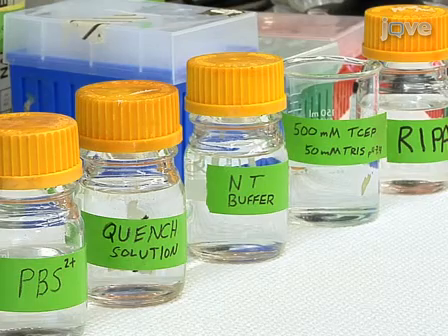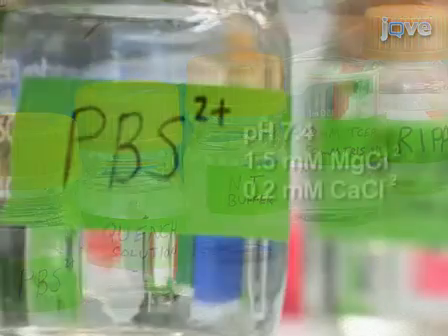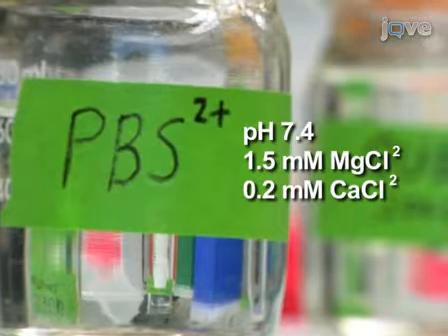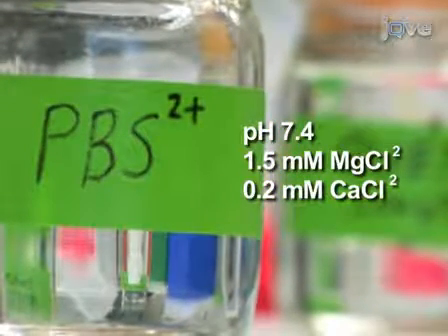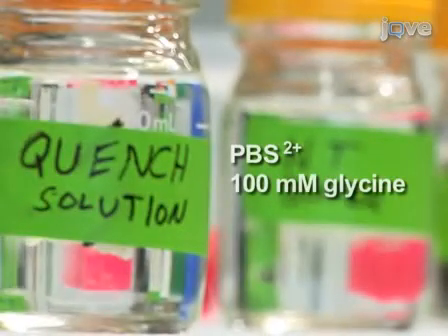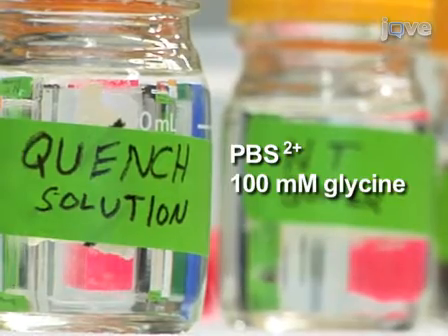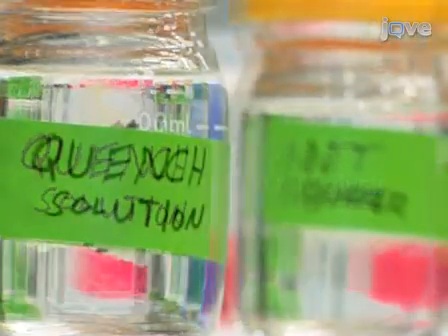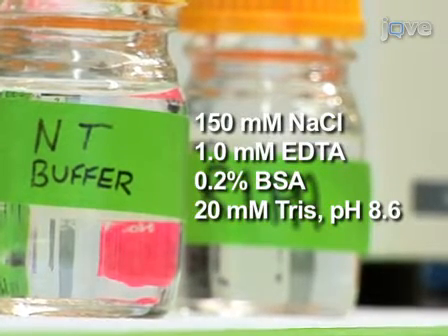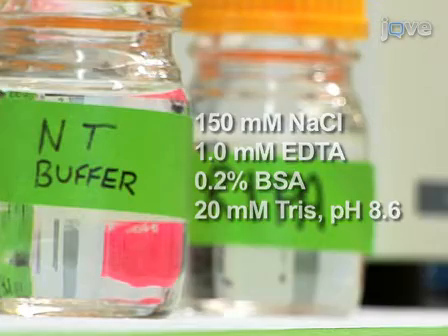After culturing cells, prepare the following solutions and store at 4 degrees Celsius for use on day two. PBS2 Plus is prepared from phosphate-buffered saline at pH 7.4, supplemented with 1.5 millimolar magnesium chloride and 0.2 millimolar calcium chloride. Biotinylation quench solution is prepared using PBS2 Plus supplemented with 100 millimolar glycine. NT buffer is made with 150 millimolar sodium chloride, 1 millimolar EDTA, 0.2% BSA, and 20 millimolar tris at pH 8.6.